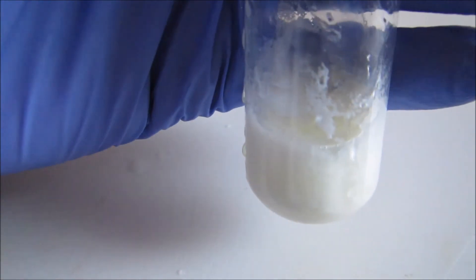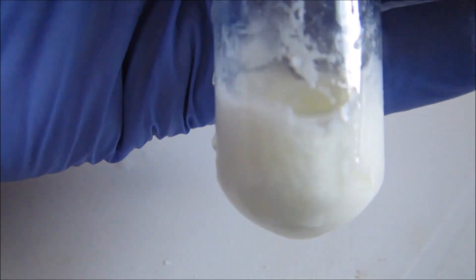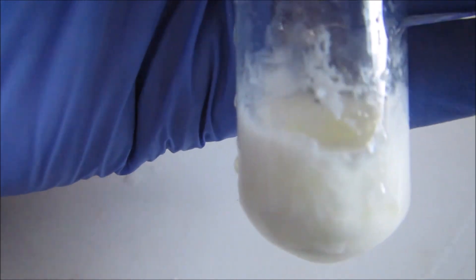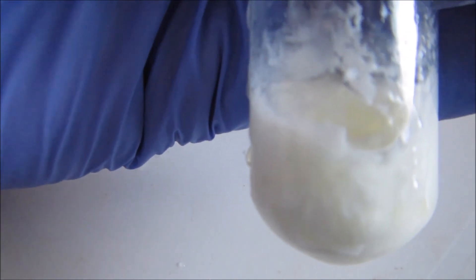And finally, the milk. You can see with milk there's a massive separation, and lots and lots of globules even floating on the top.